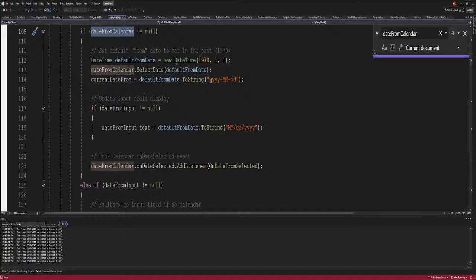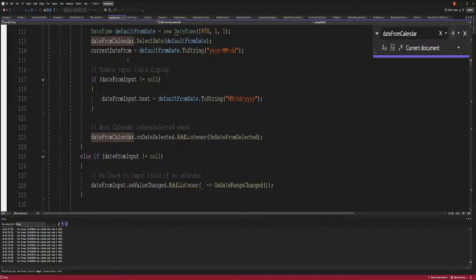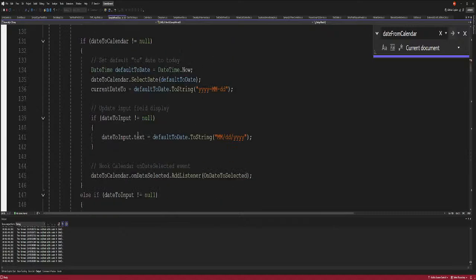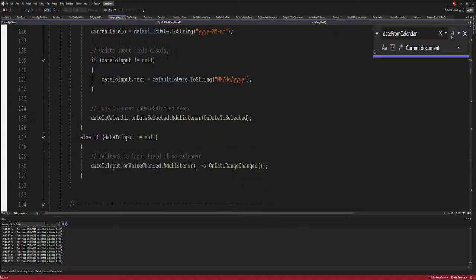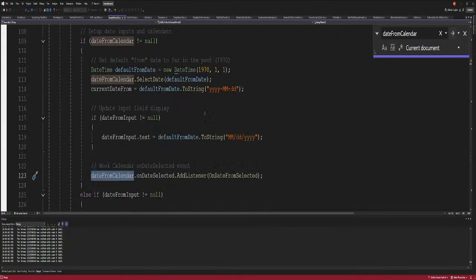This is what I got wrong. So I got year, month, day. That's the way we're doing it, right? And then from here we do the same for the input and output, the date input and the date output. Then for the date calendar, we select the current date. We're setting the default date, right? Then we add a listener.